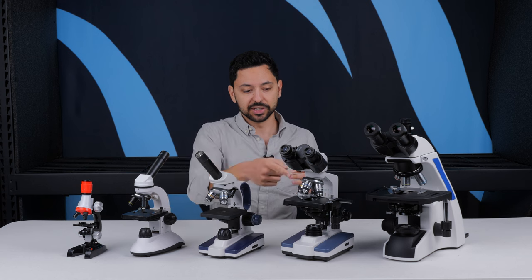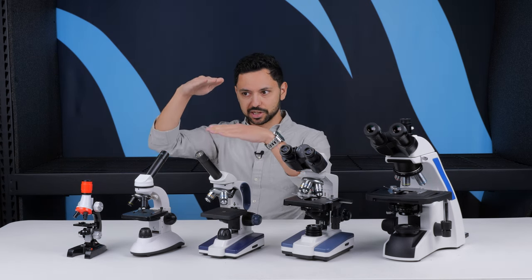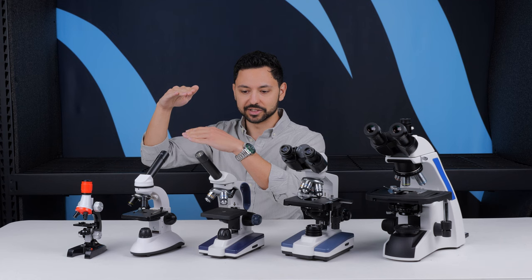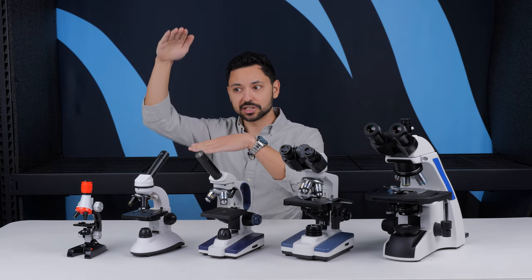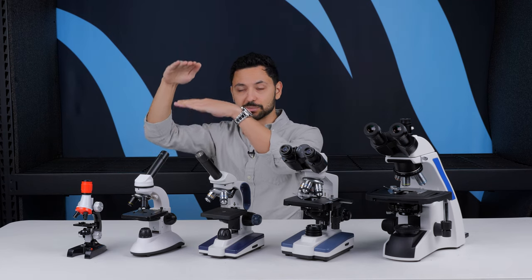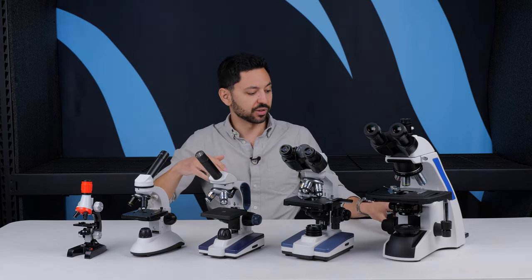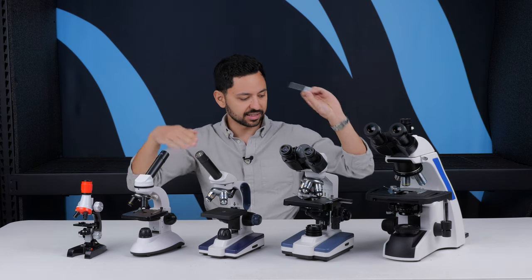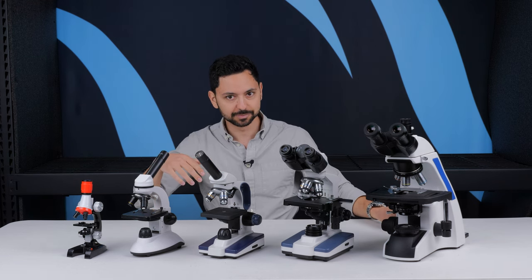What it really comes down to is that the depth of field — the amount of your sample that's in focus at any given time at high magnifications — is going to become smaller and smaller. And so that's why you need this kind of planar thin section on a microscope slide.